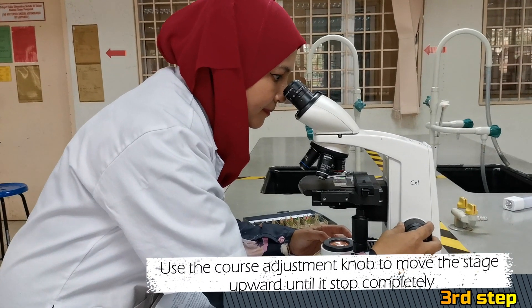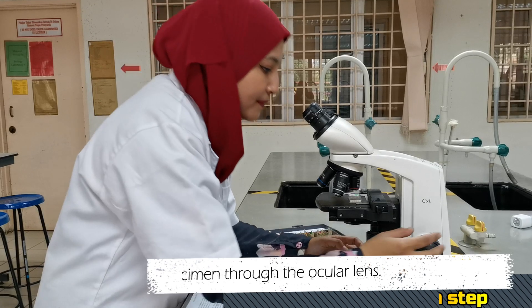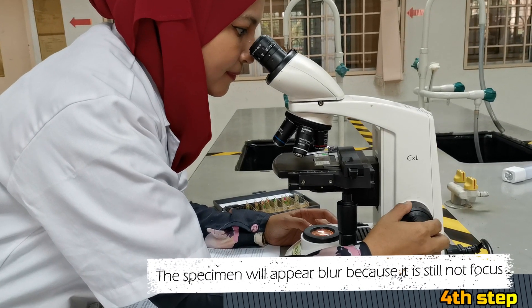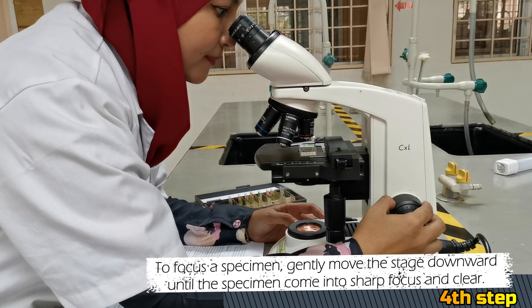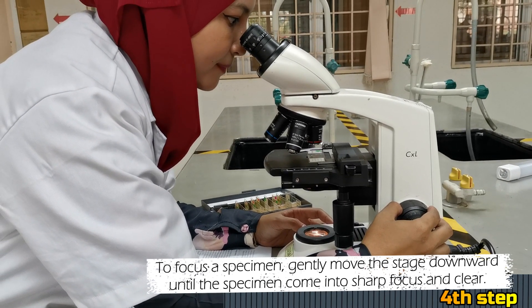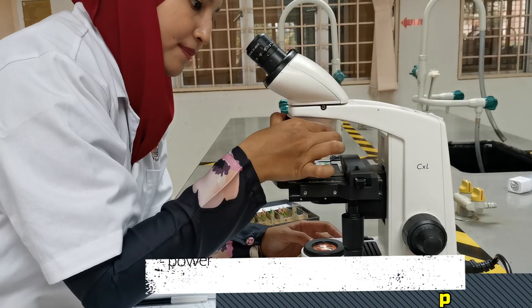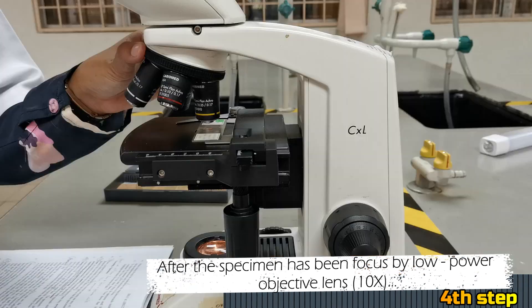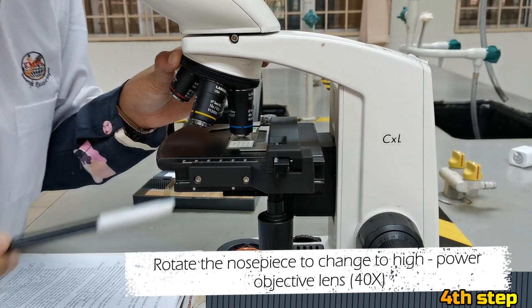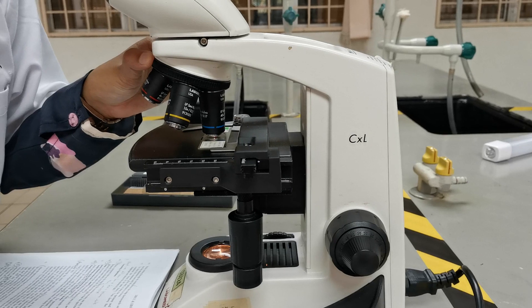Third, use the coarse adjustment knob to move the stage upward until it stops completely. Fourth, observe the specimen through the ocular lens. The specimen will appear blurry because it is still not focused. To focus the specimen, gently move the stage downward until the specimen comes into sharp focus and is clear. Remember to look through the ocular lens with both eyes. After the specimen has been focused by the low power objective lens, rotate the nosepiece to change to the high power objective lens, which is the 40x objective lens. You will hear a clicking sound when the objective lens comes into its correct position right above the specimen.